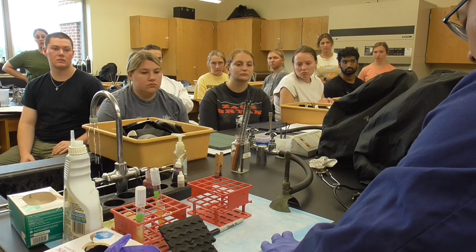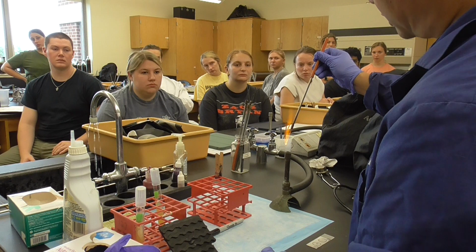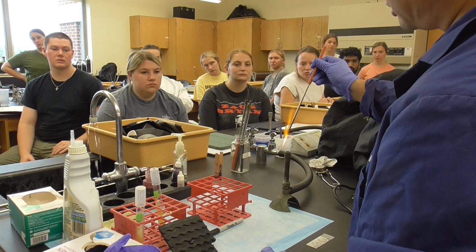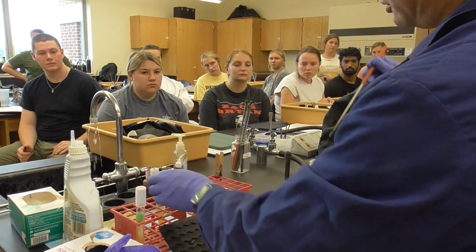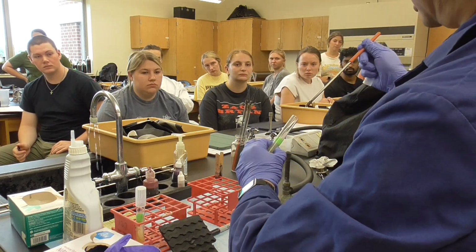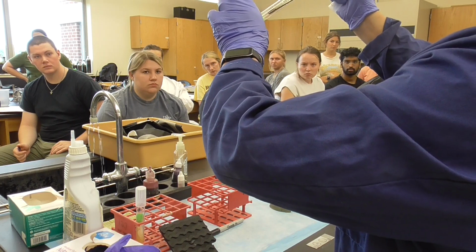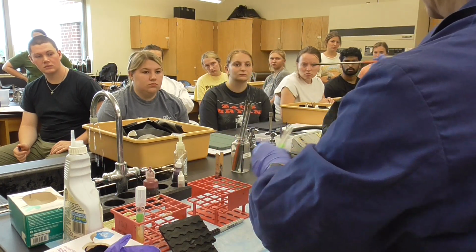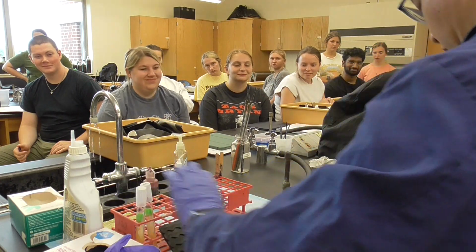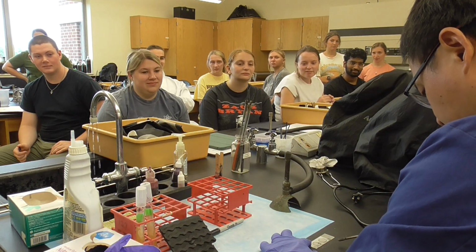Don't put too much water. A little bit is good. Then you sterilize it again because you're going to put another bacteria there, otherwise it will cause cross contamination. So flame again, cool down, and then you pick the bacteria from the side. Okay. Don't block it. Okay, now on this side here, you're going to pick the bacteria, so you make the smear.